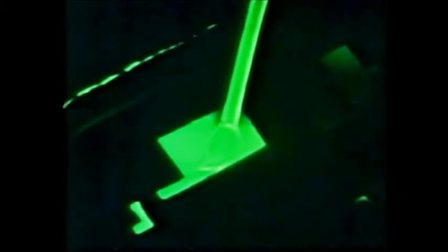If now we examine the input terminals, we see that although the signal is present on this wire, the bonding pad remains dark, indicating a fault condition. This situation may be compared with a good connection seen here. In the faulty case, a residual oxide layer on the bonding pad is responsible for the electrical isolation.